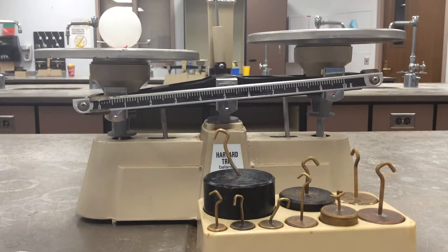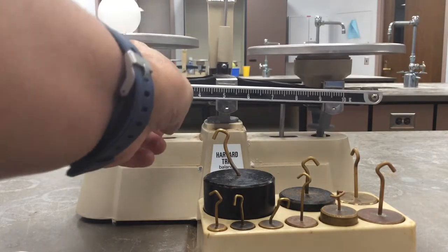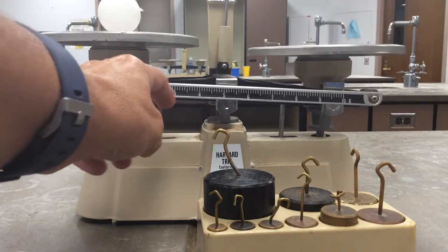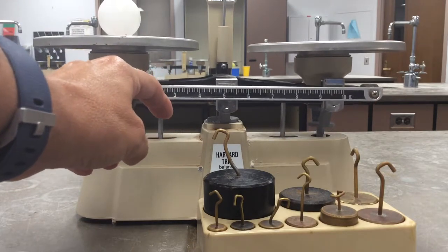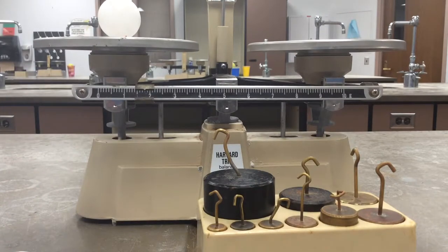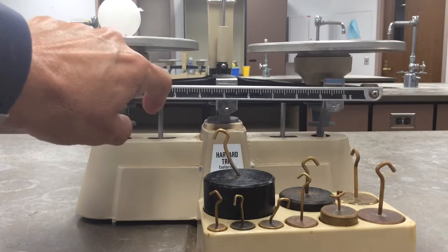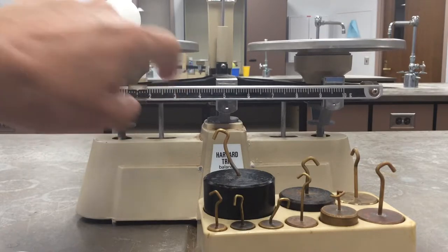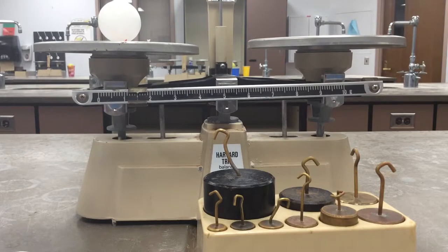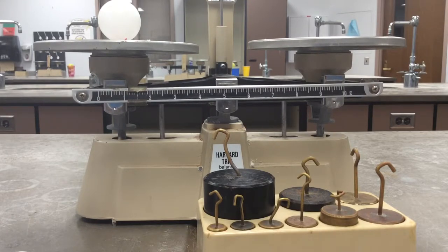Since this is going to be an item that has less mass, I'm going to start with the rider here. Already I can see that it doesn't have much mass, so I'm going to wait till it gets to zero on the scale and I might have to move it down a little smidgen. Everyone in the class is going to need to use these because we will use these throughout the year.